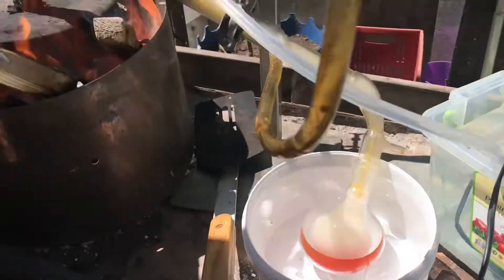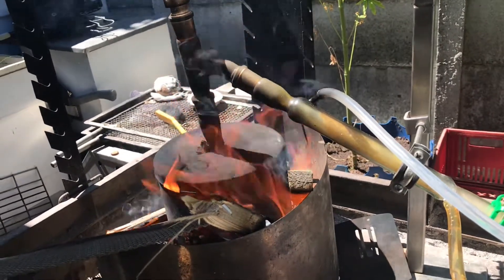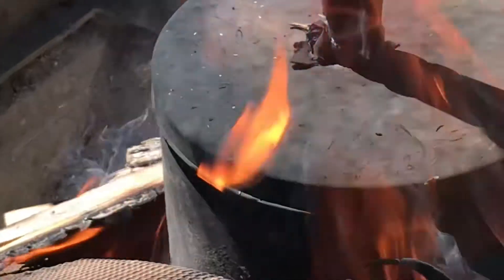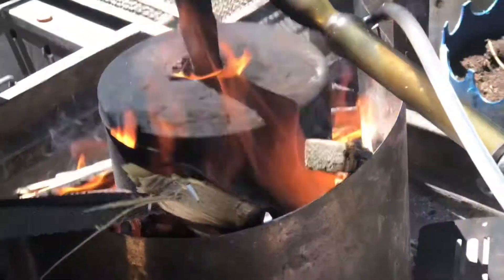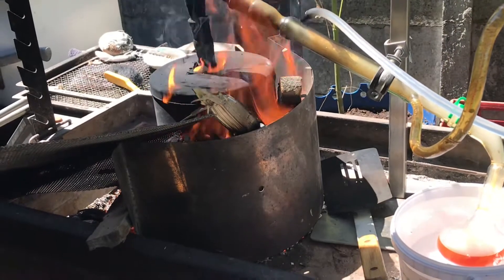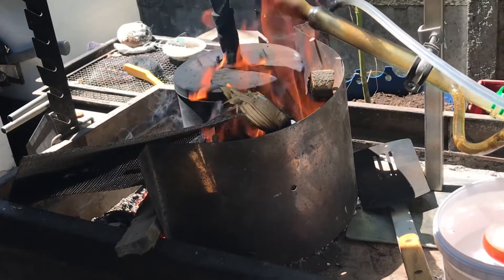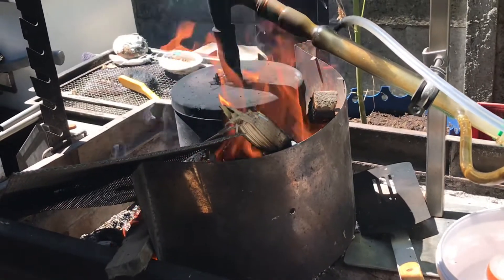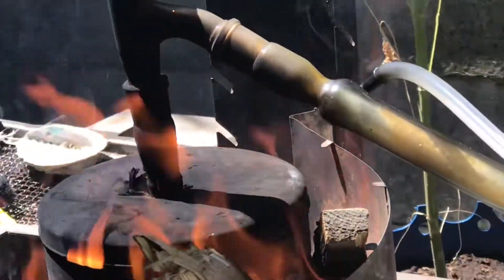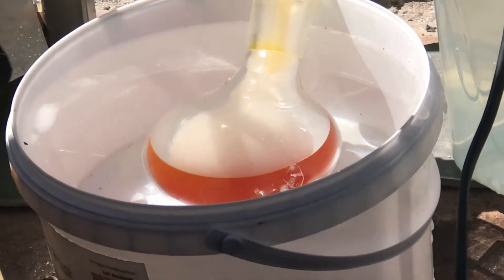No other chemist would probably put their glassware to this type of torture, but it seems to be working. As you can see there's a leak on the can by the joint. I can blow it out and it'll re-ignite, but I actually prefer it burning like that because the flame won't jump back into the can — there isn't any oxygen in there. I'd rather have CO2 in the air than benzene fumes, so it's better to have it burning. The glassware is quite black from all the smoke but we still have quite a lot of benzene coming through.